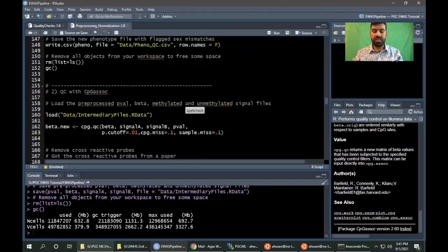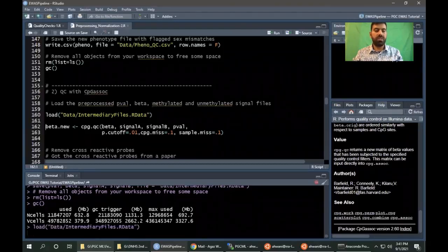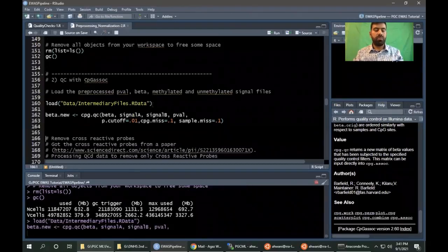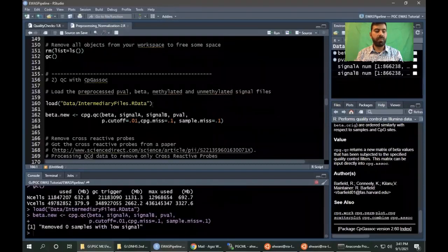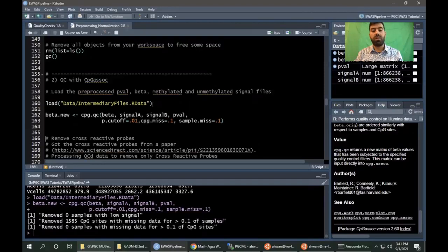Now, when we have saved the data, we will load the data here and do the check, that is to remove the low quality probes and samples. If there's any sample that has greater than 10% of the missing values, or any probe with greater than 10% of the missing values, we will remove that. As you can see, 0 samples have been removed, but 1585 CpGs have been removed due to higher missing values.